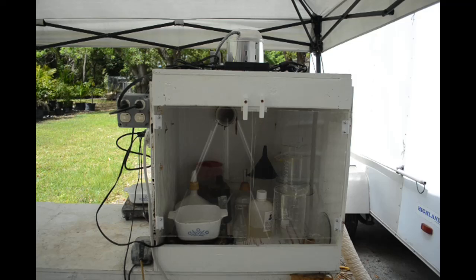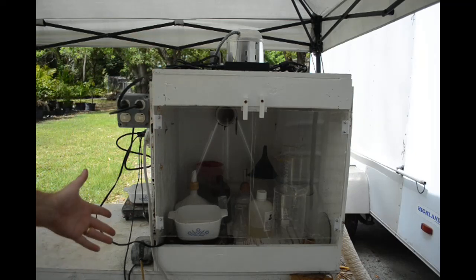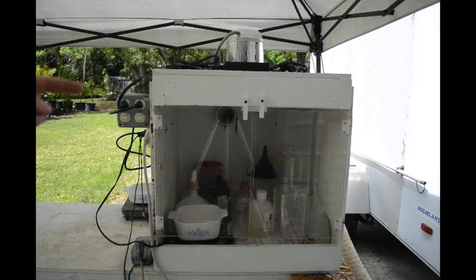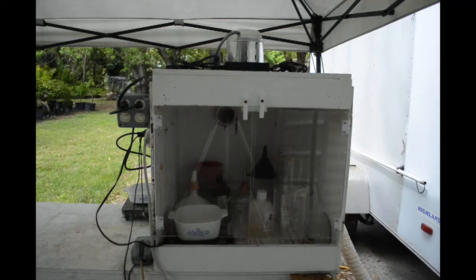The four-sided box worked out pretty good - just the two sides, the back, and the top. The bottom is open, it's just the workbench. And the front I put the plexiglass doors on and the plexiglass doors actually worked out pretty good too.